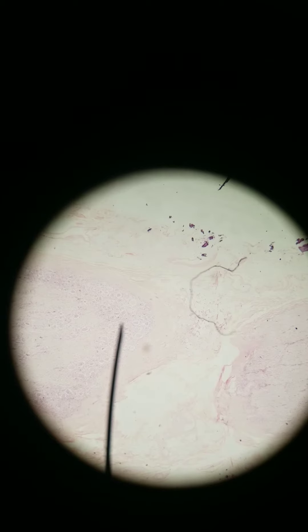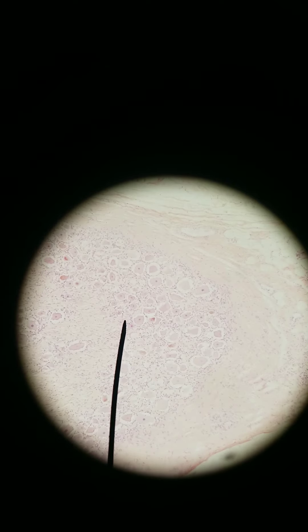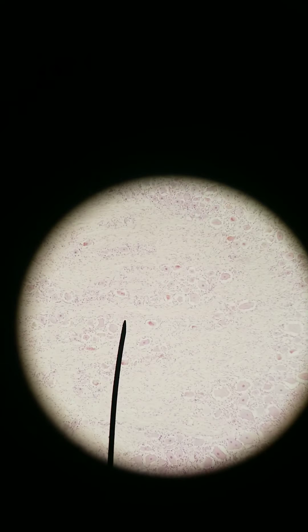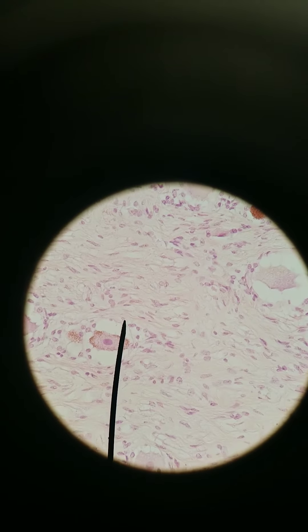Let's go a little closer — here's 100x. You can see the large cell bodies of those pseudounipolar neurons. Where are their axons? It's where we start to see these more fibrous-looking linear axons. Going to 400x now — these are the axons, off to the side, with cell bodies clustered in a different area.